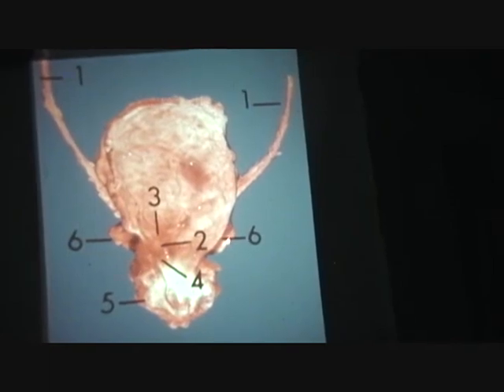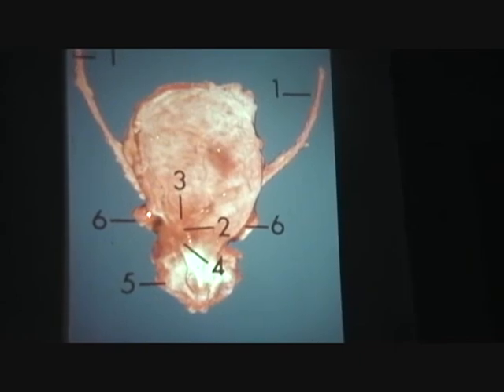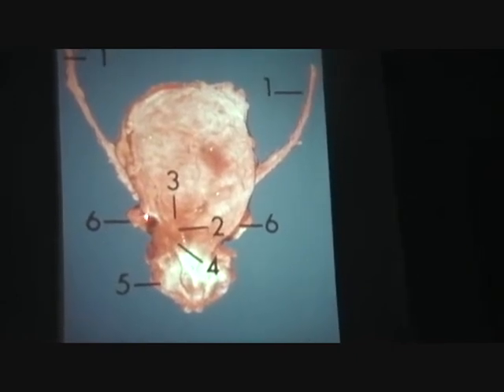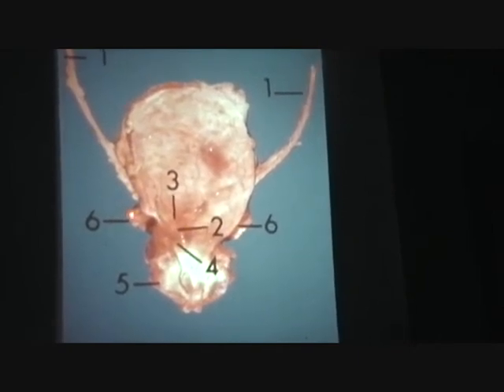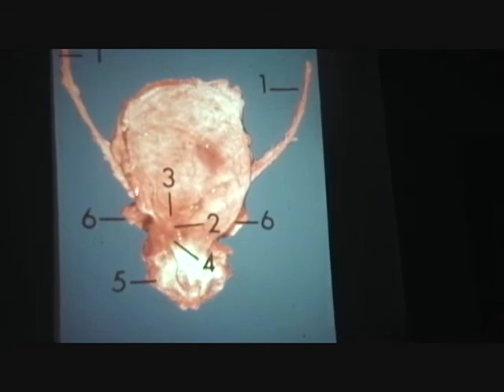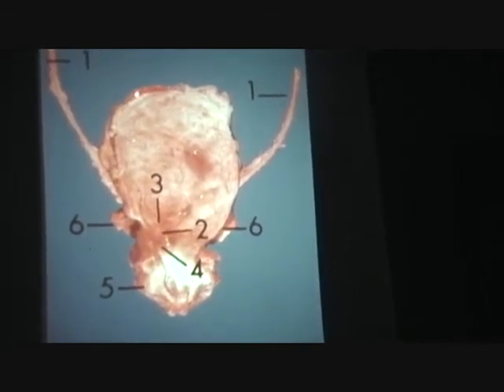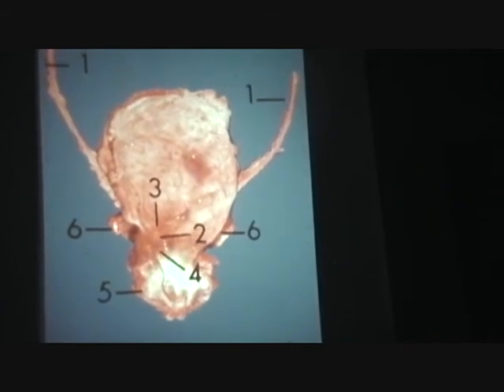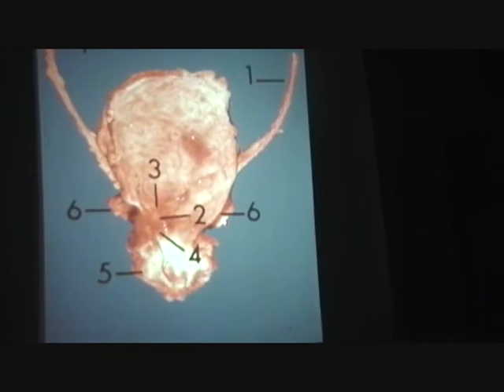Peeking out from behind. Could you tell what those are? Little ears. Yeah, seminal vesicles. I did bend them down a bit. I would always show you them from a posterior view. You can get them to peek out a little bit if you push it forward. Seminal vesicles, right and left.